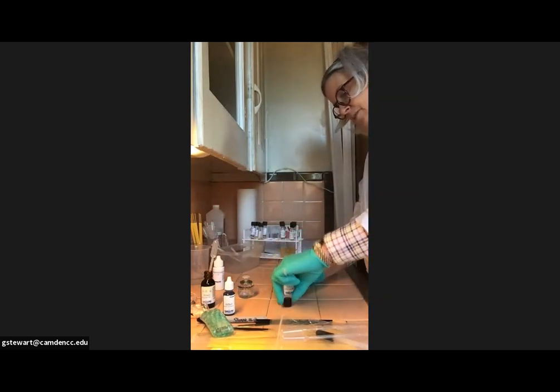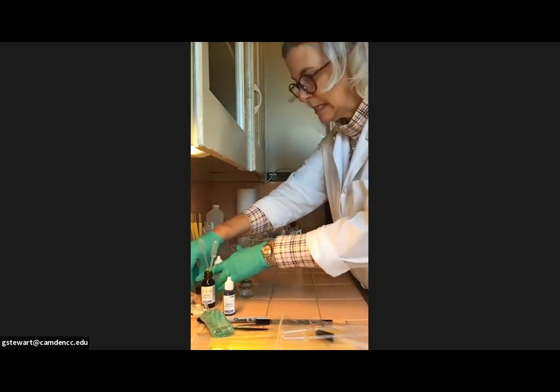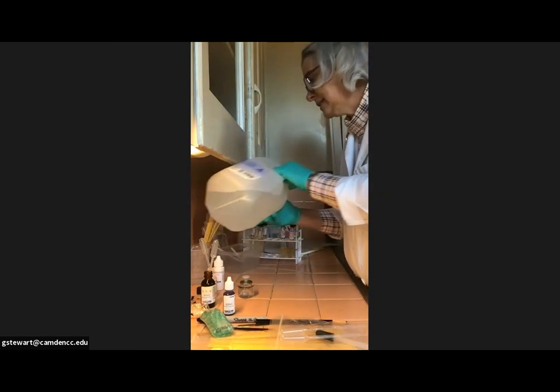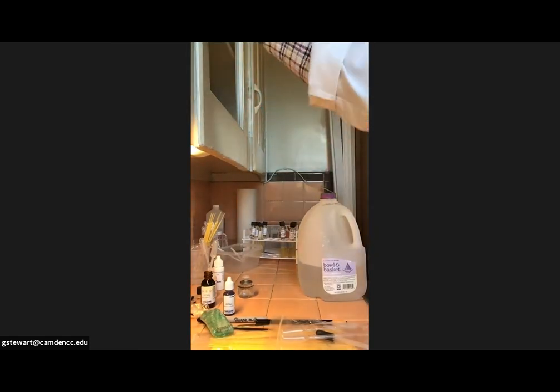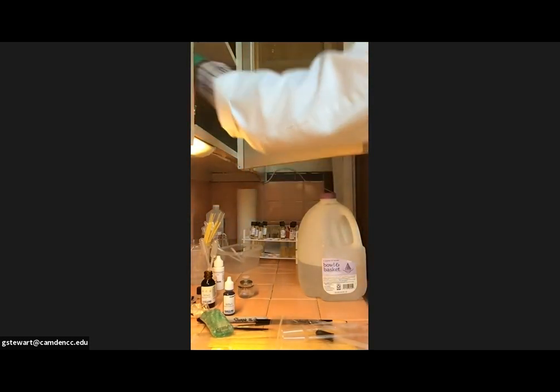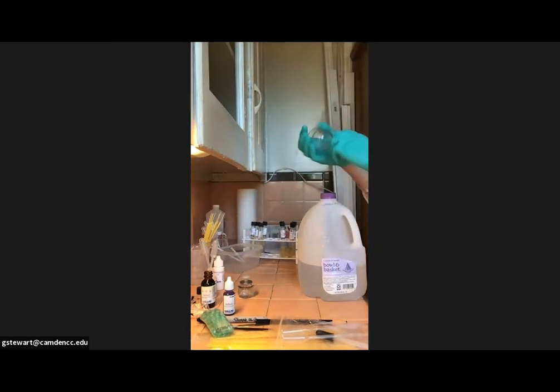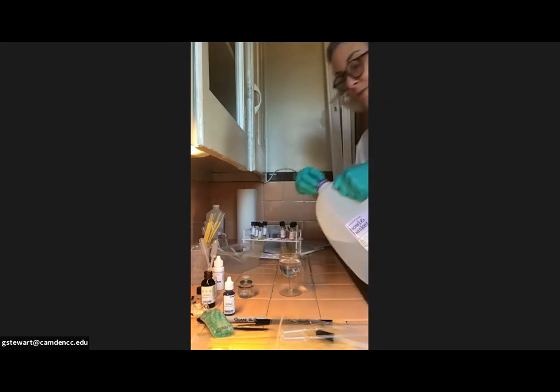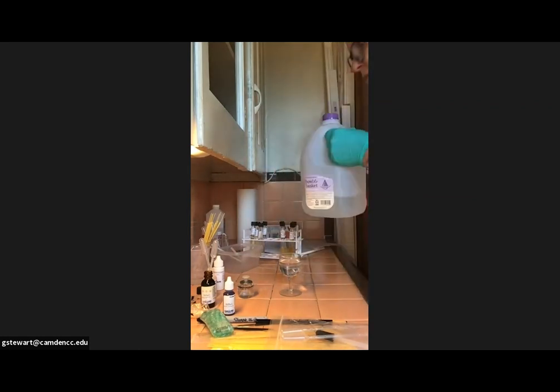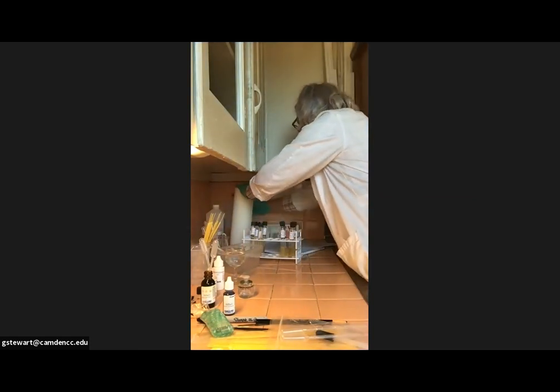And what I did notice is we need to rinse frequently with distilled water, and they did not give us a bottle of distilled water. So I have my big jug of distilled water here, and I'm looking around in my kitchen cabinets, and since it's just distilled water, I think it's okay. I'm just going to use a teacup, I think, or maybe a glass. Let's find a glass. All right, all I have are these little cordial glasses, wine glasses from my grandmother. So I'm just going to put my distilled water in there because that's what I happen to have. You're more than welcome to put it in a beaker or another one of these plastic cups. That's probably what I should do, is go downstairs and get a plastic cup, but I'm kind of in a hurry, so I'm just going to do that. All right, I'm going to stick the rest of my distilled water back here in the back.